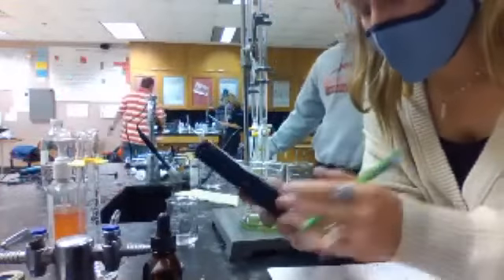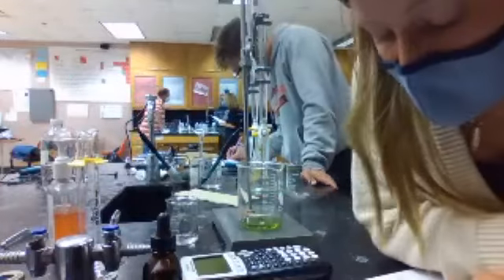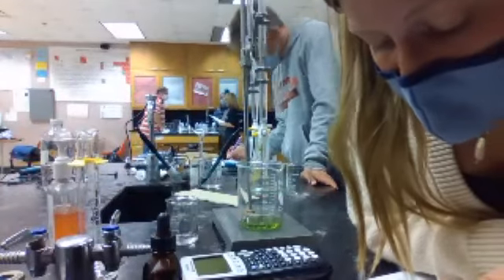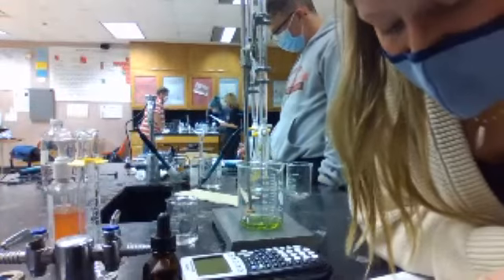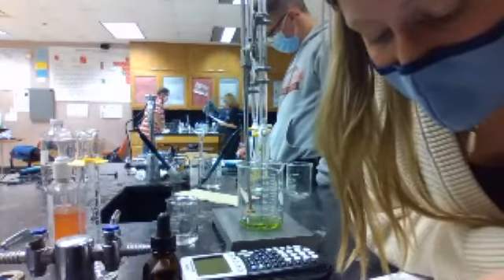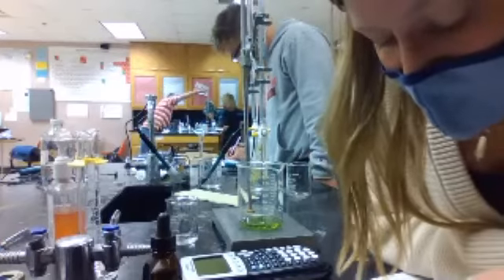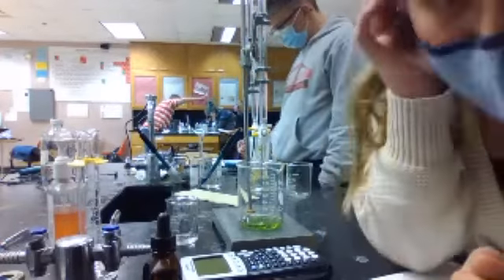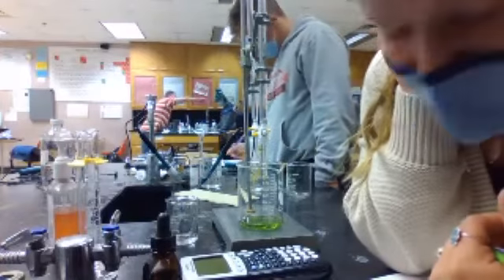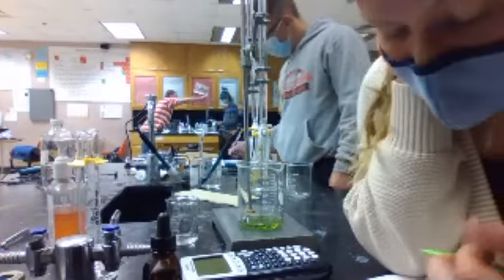All right, we did titration. Okay, so for trial number 1, the initial volume of the acid is 0.00, and the initial volume of the base is 0.19. The final volume of the acid is 9.99, and the final volume of the base is also 9.99. Then we subtract the final volume minus the initial. So your actual volume for the base should be 9.99 minus 0.19, and for that I got 9.8. And for the acid, it's just minus 0, so it'd be the same.